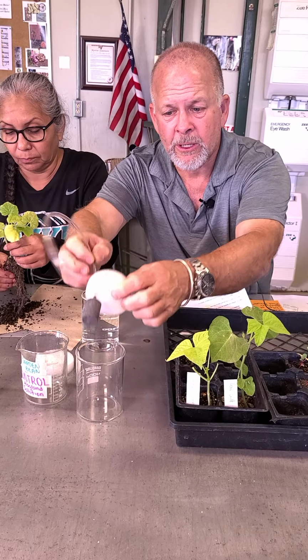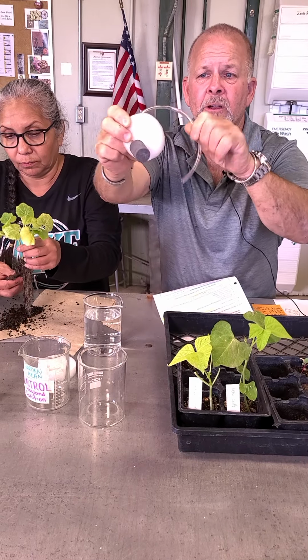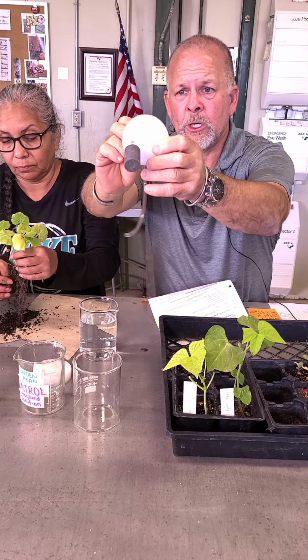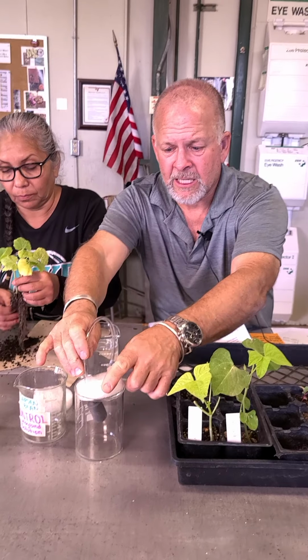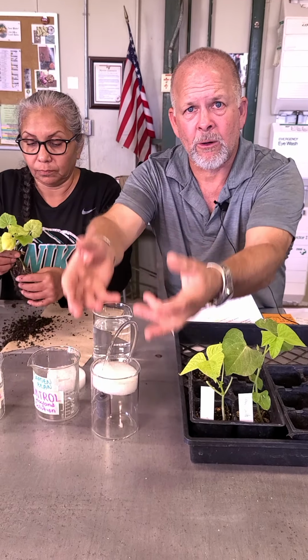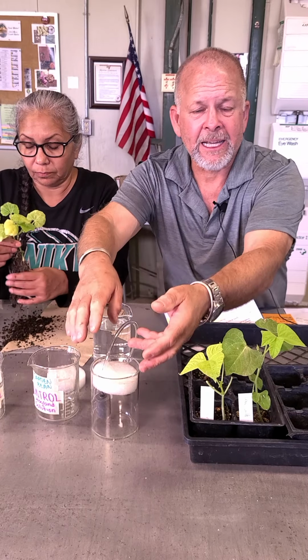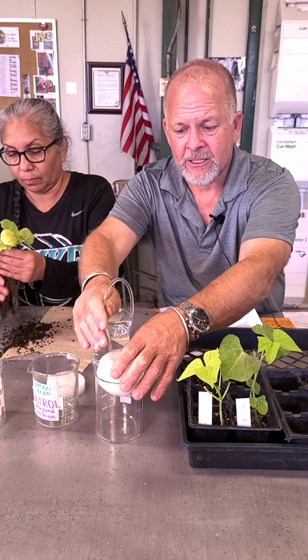So we found if we put another hole in this, there's another hole right through there, see that? I'm not going to put anything in it. We could put a glass tube in it, but we realized that if we just did that and we put this in, the extra air would be able to come out through that, and we wouldn't really get a whole lot of floating effect, like an island effect of this raft of plants in this disc going up and down.